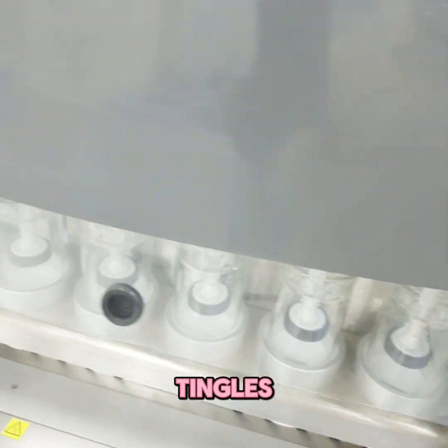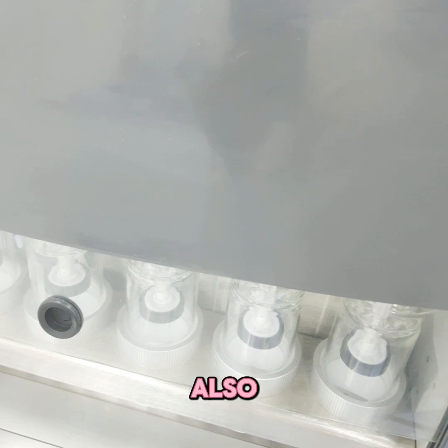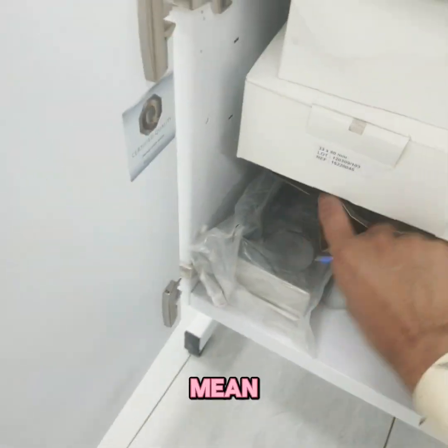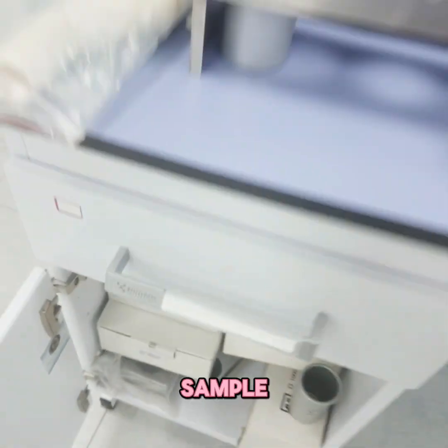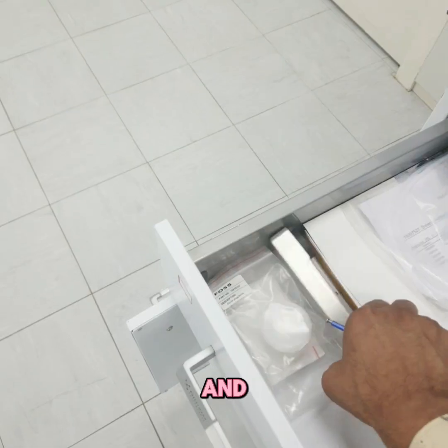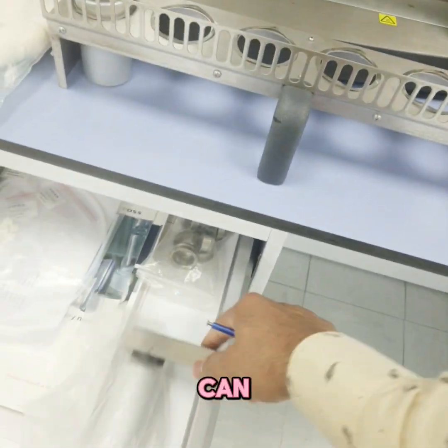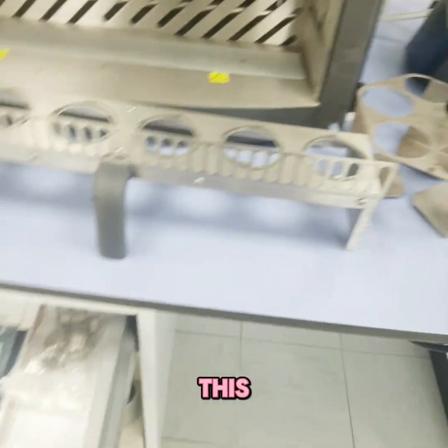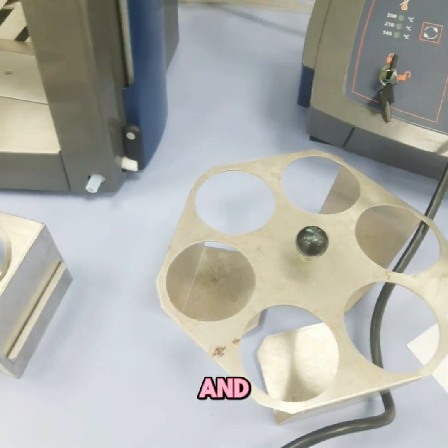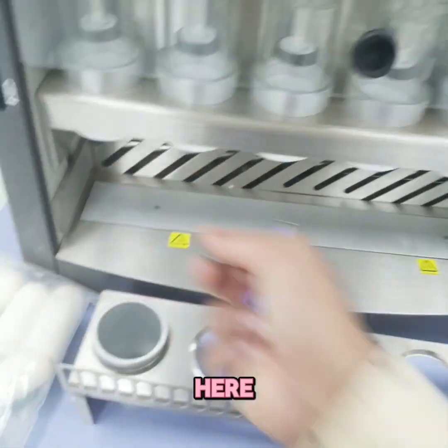Thimbles are available in different sizes, such as 33 mm, in both single and double thickness. There are also different sample holders for storing samples after analysis. The cups are magnetic, so if you have an iron or metal cup you can simply touch and transfer it easily. Excess solvent remaining can also be purged from here.